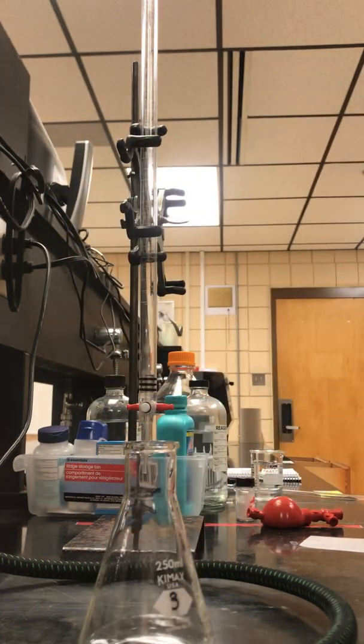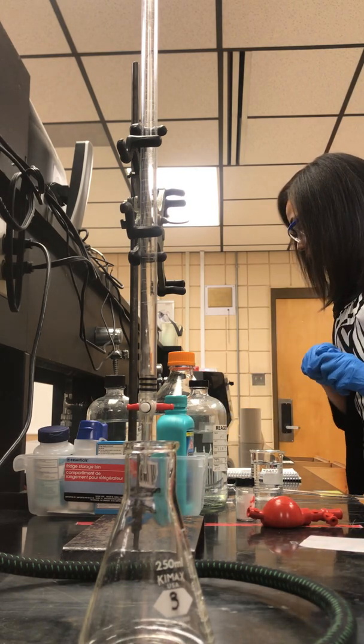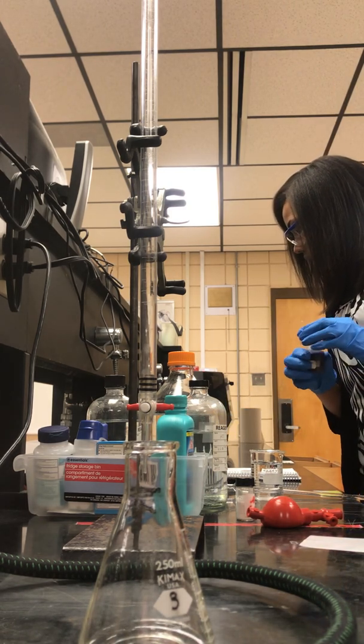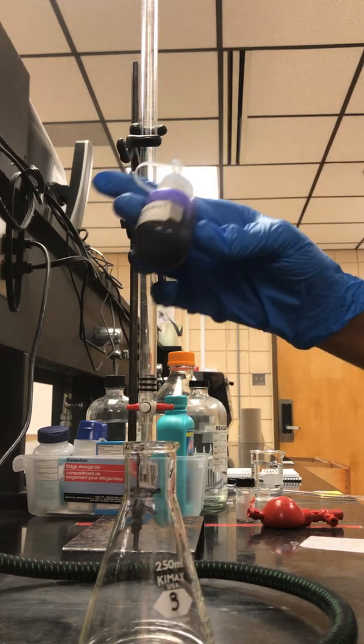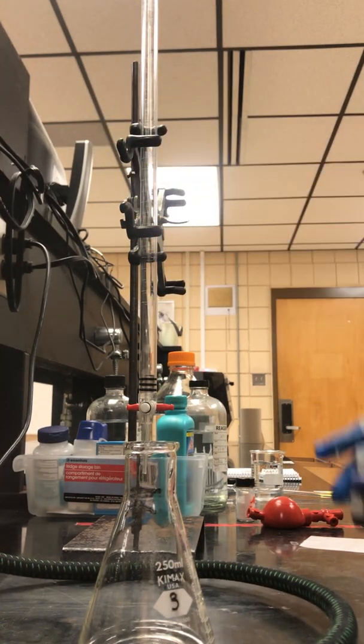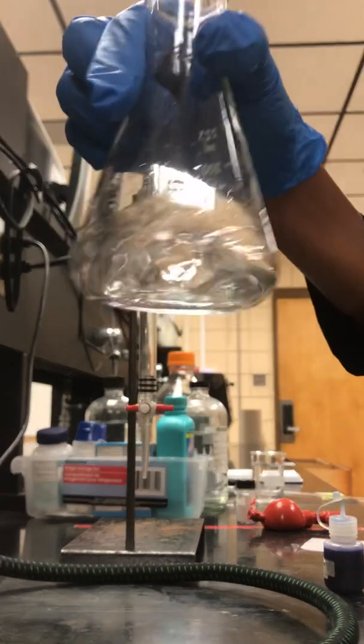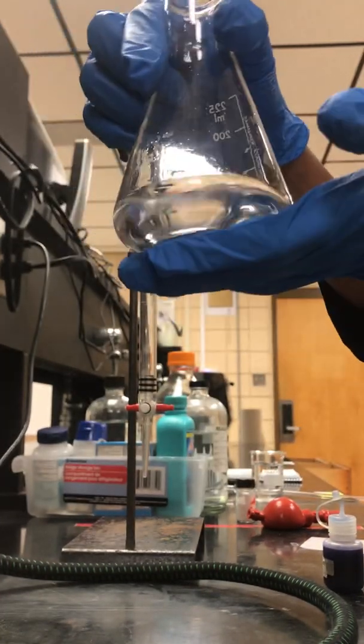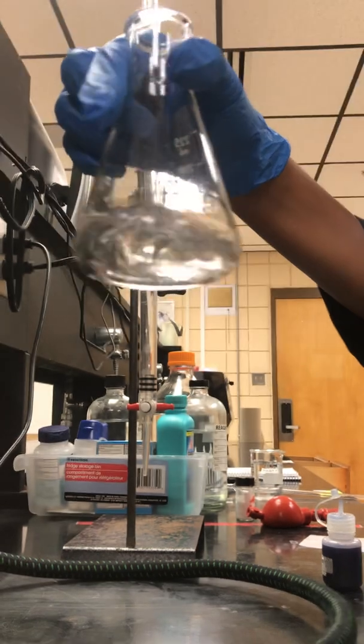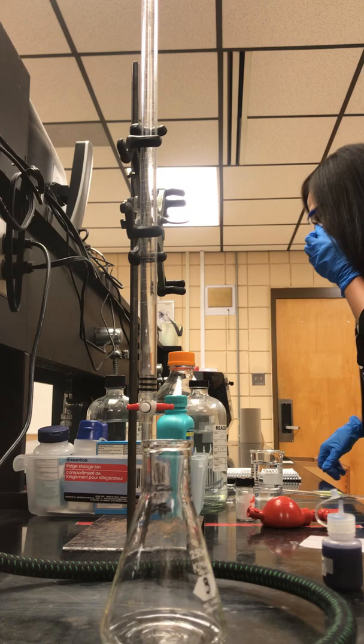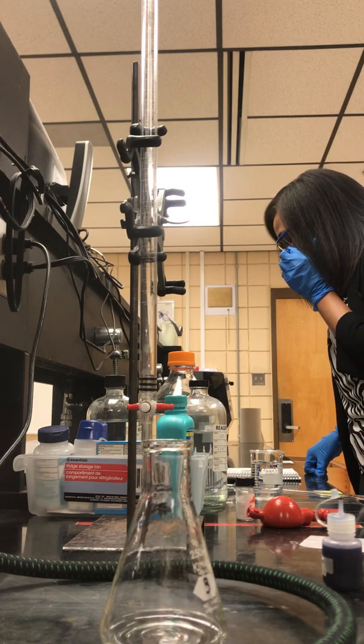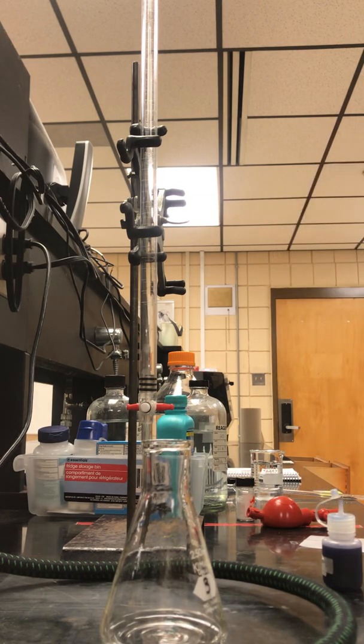After it has dissolved, you're asked to put in four to eight drops of bromophenol blue. But before you put in the bromophenol blue, you're asked to heat up the antacid with the acid to see if you notice a color change.